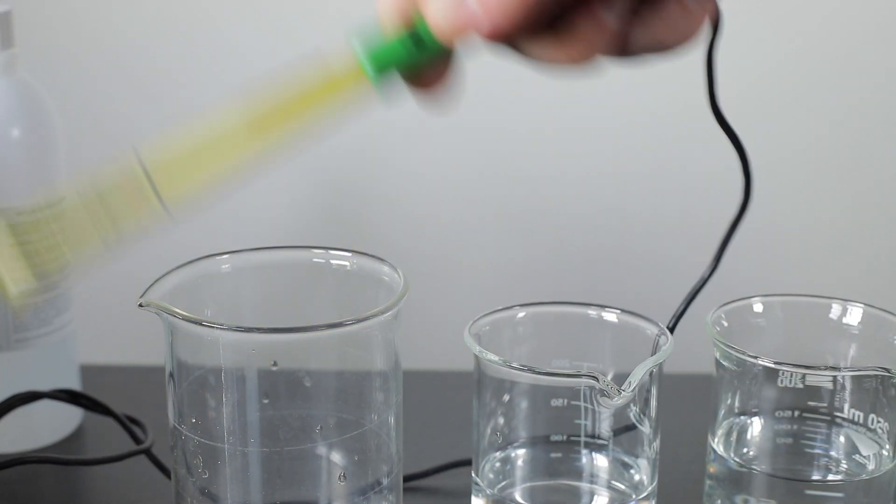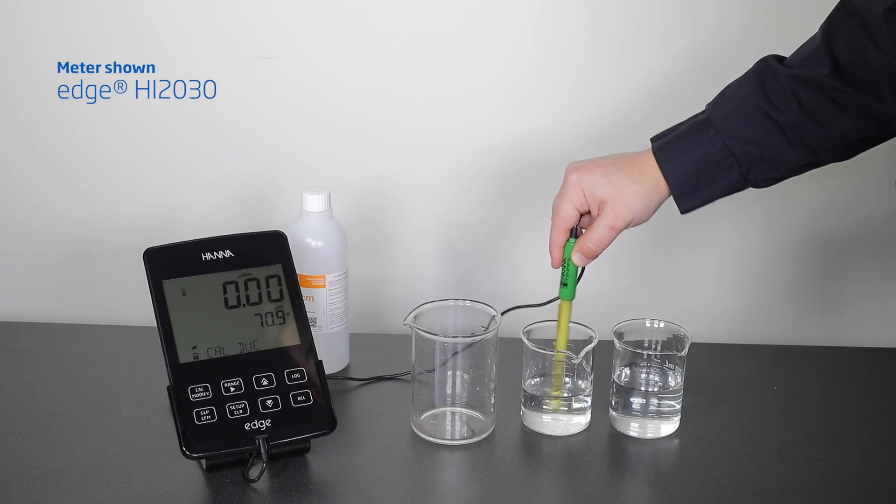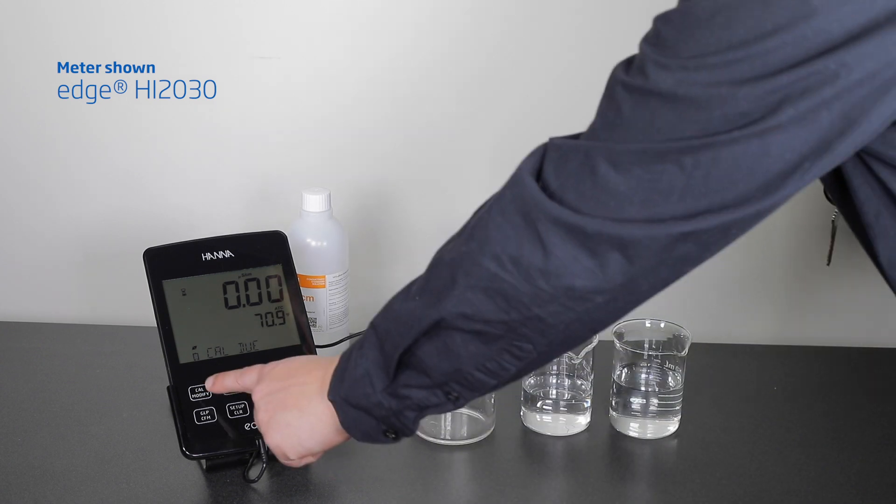Gently shake off the excess water from the probe, immerse the probe in a beaker or cup with some standard, and swirl the probe.